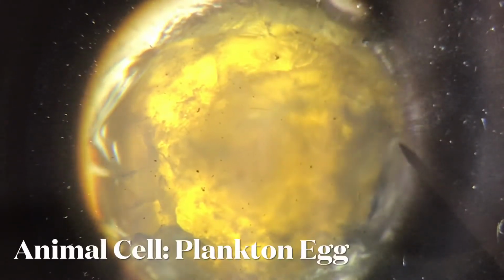Okay, so you can see that this cell is actually quite big. And if I shift its position, you can see that it is actually a round thing. Do you want to make a guess what this is?